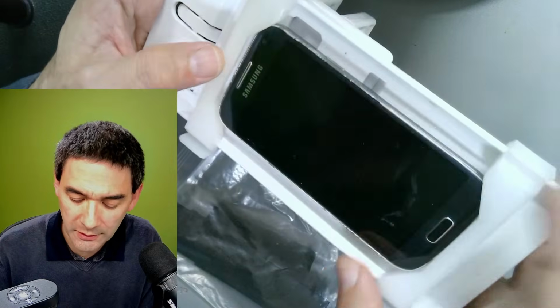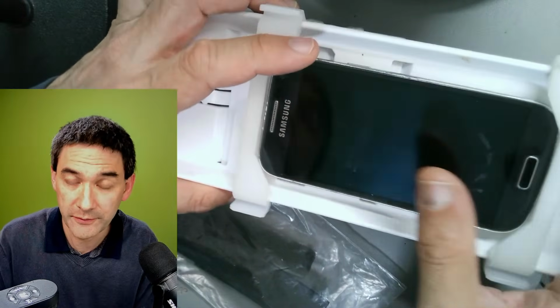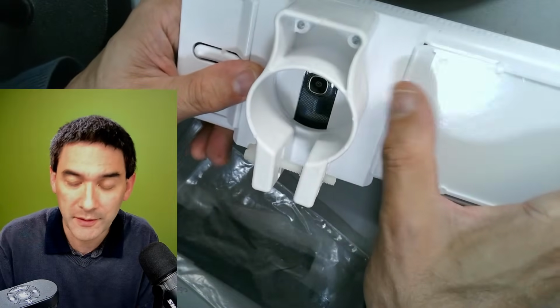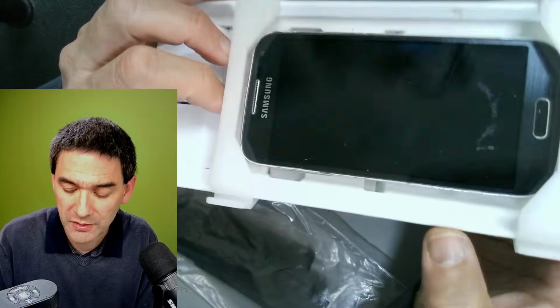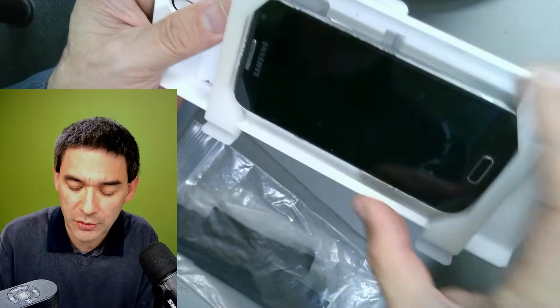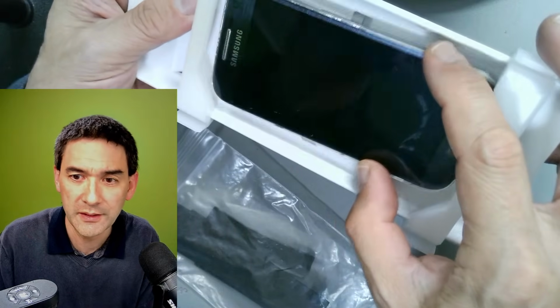So what I have done in order to stabilize it more, after everything was centered and adjusted, I used some sticky tape and I taped everything so that you cannot move it anymore. So that's the solution that I had. Otherwise, there's also the danger that if this goes apart, then of course the mobile phone falls down, right?